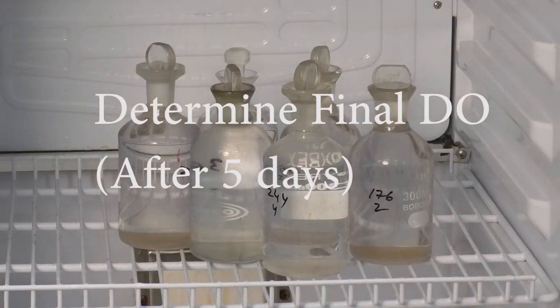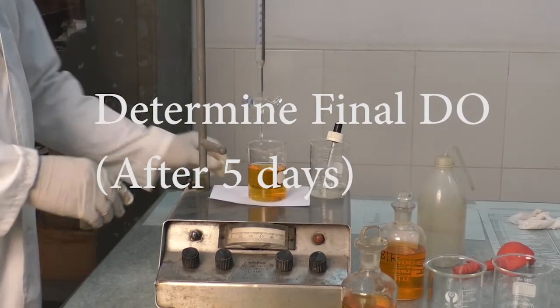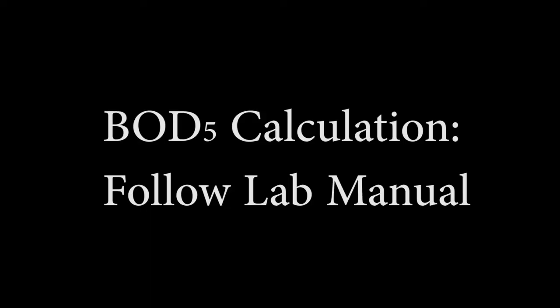In a similar way, after 5 days, we will take the samples from the incubator and determine the dissolved oxygen, which will be the final dissolved oxygen. By taking the final dissolved oxygen and initial dissolved oxygen and the appropriate formula from the lab manual, you will be able to calculate the BOD of the sample.